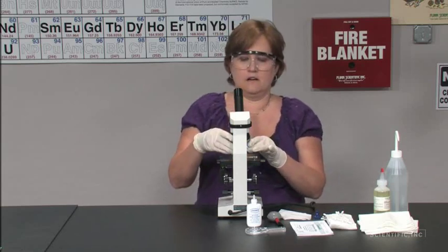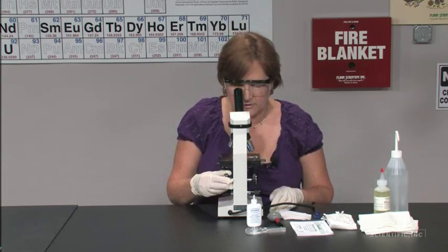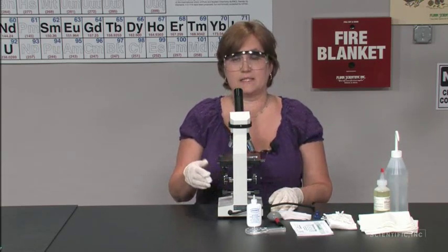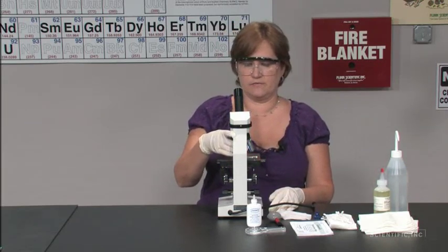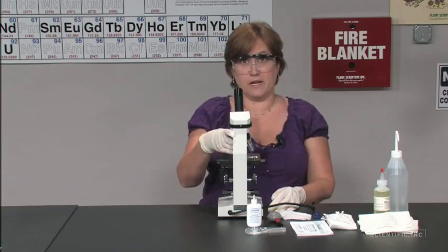Once again, checking for completion. It may take several rounds of cleaning in order to get the objective clean. You'll do the same with the 40x.